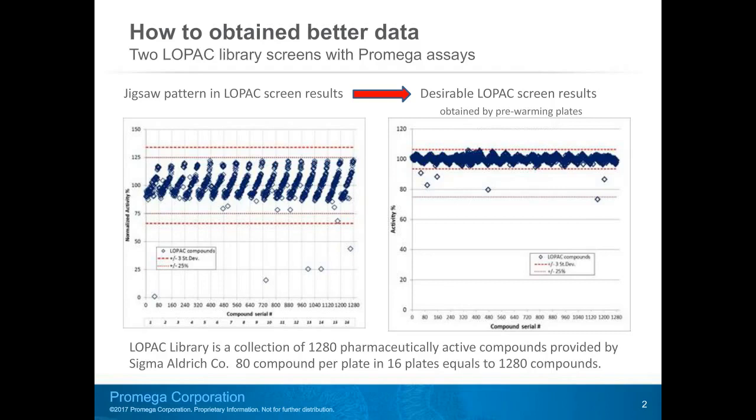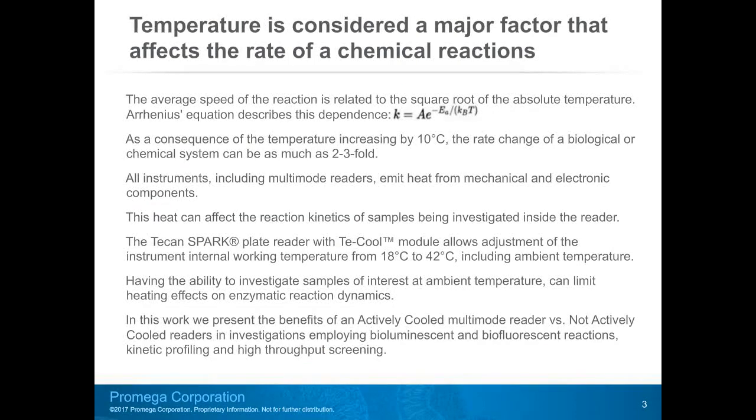After processing multiple screening data sets, I was quite puzzled by the jigsaw pattern or periodicity of the data I observed in all of my screens. The graph on the left, data of 16 plates, shows that each plate displayed an obvious gradual signal increase through each of 80 data points. We'll come back to this graph a bit later. Of course, a much more desirable and expected data distribution would be the right graph. This observation inspired me to investigate this phenomenon and to find solutions to avoid it.